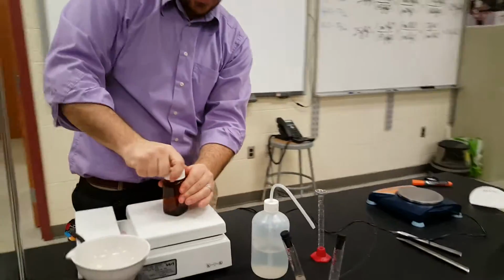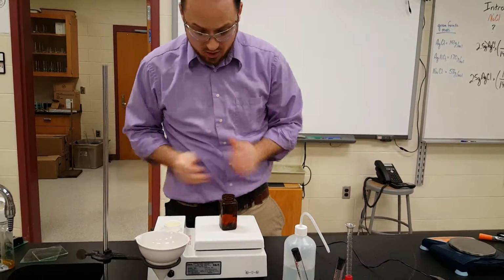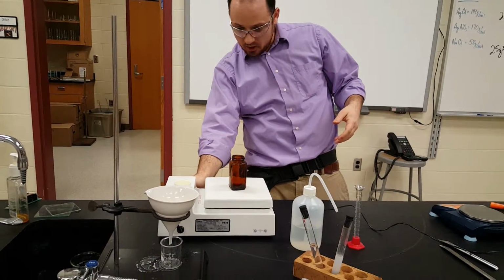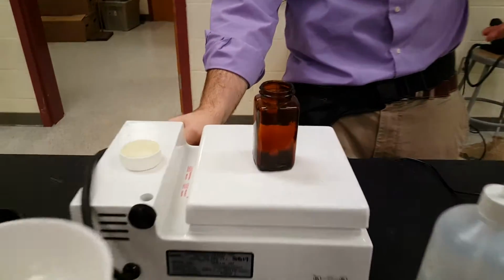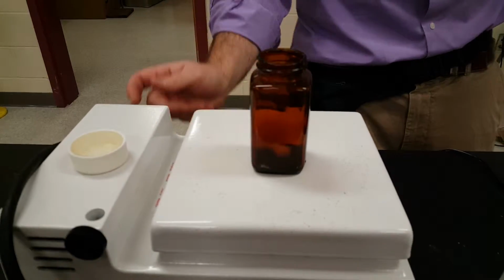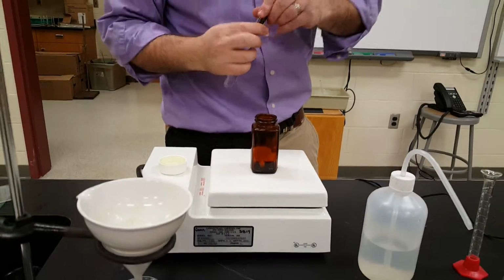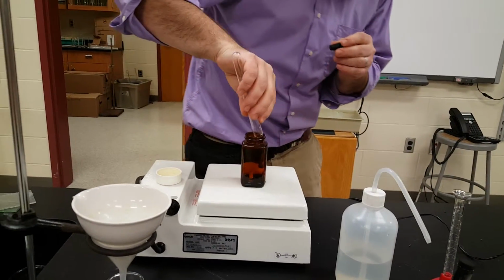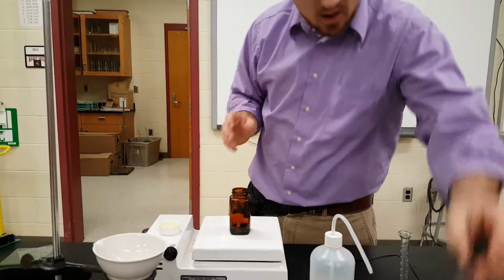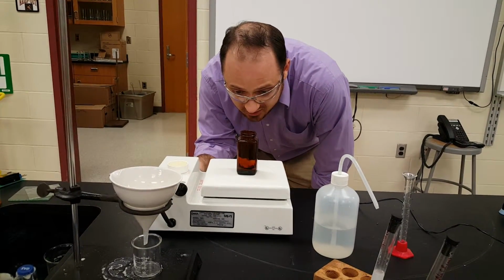So I've got to make sure that's all gone right there. And I'm going to react it in this light-proof vessel. Push down, unscrew open. I'm going to get my stir bar going in there a little bit. I'm going to add the salt in first. All right, so just good old table salt. It's clear now. Okay, it's all dissolved. Add that in. In it goes. And let's turn up the spin a little bit, just gentle, not a ton.